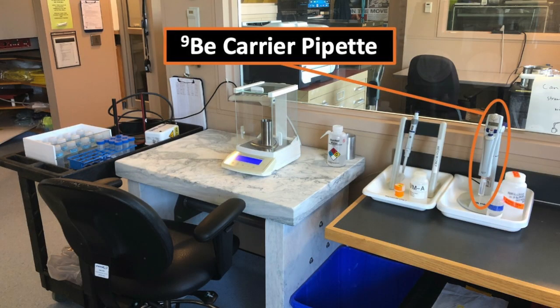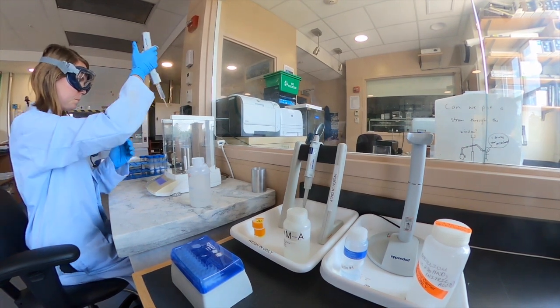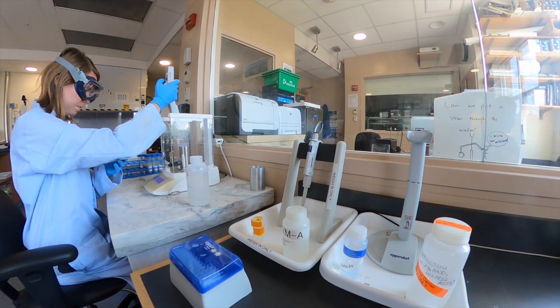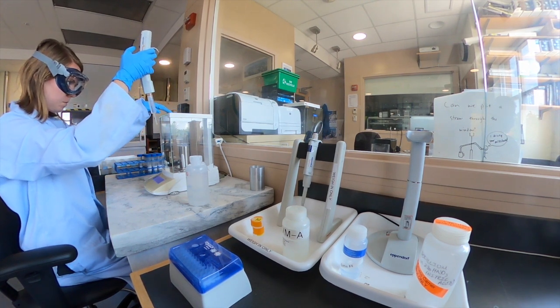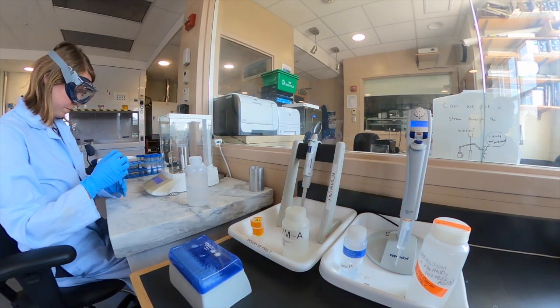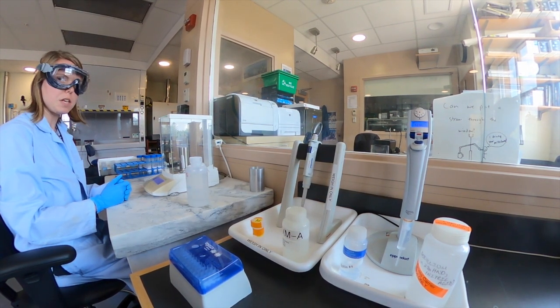We have a beryllium-9 carrier pipette, and this is a really fun pipette to use. It's electronic, it has a reservoir, and so each time we push that button on the top, we can dispense about 250 micrograms of beryllium-9 into the sample. And of course, we do that by mass, and we read the mass of that addition. Okay, the beryllium mass is 0.8337.